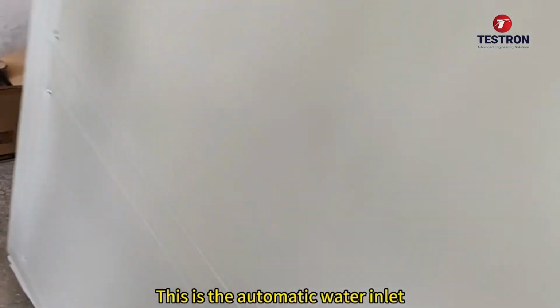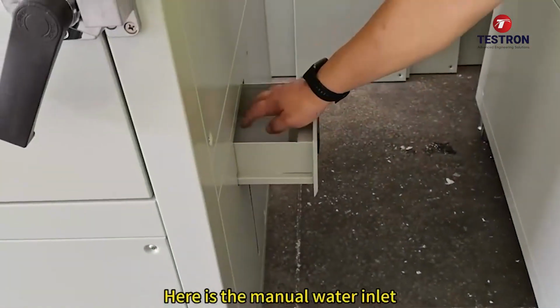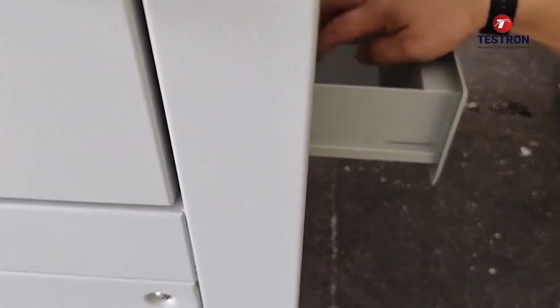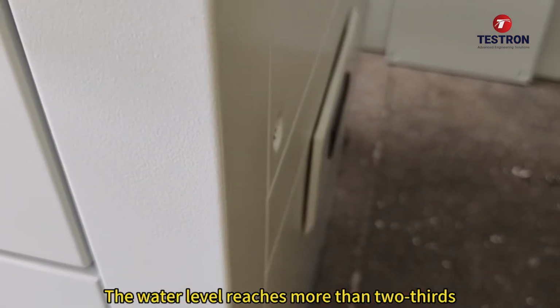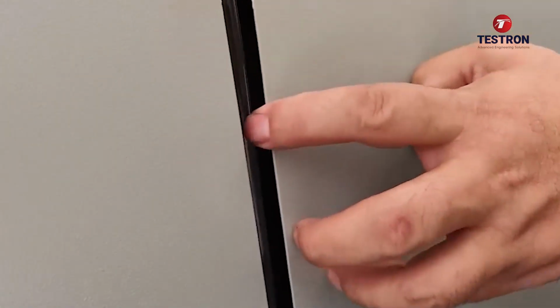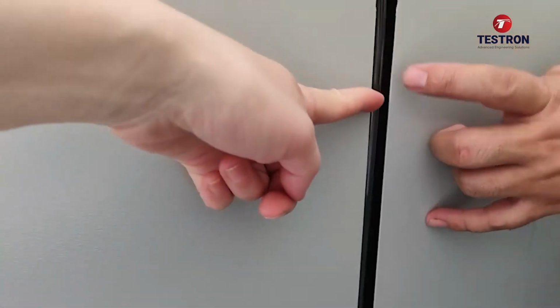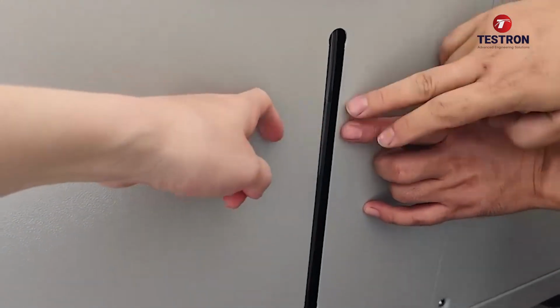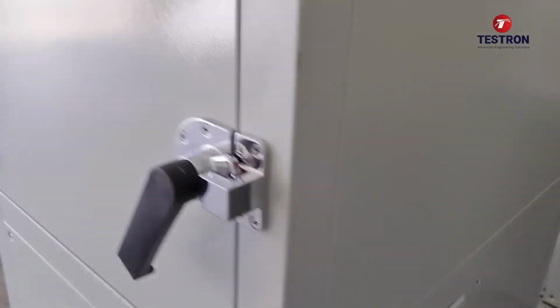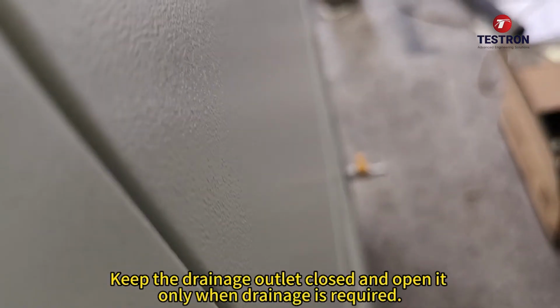This is the automatic water inlet. Here is the manual water inlet. The water level reaches more than 2/3. Keep the drainage outlet closed and open it only when drainage is required.